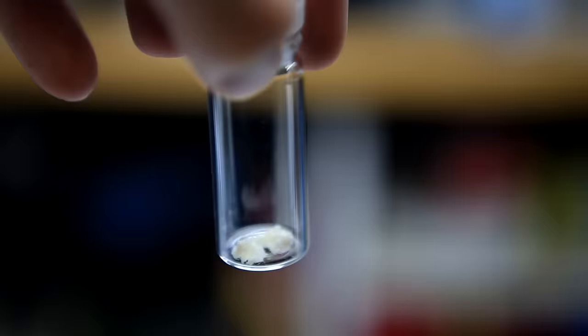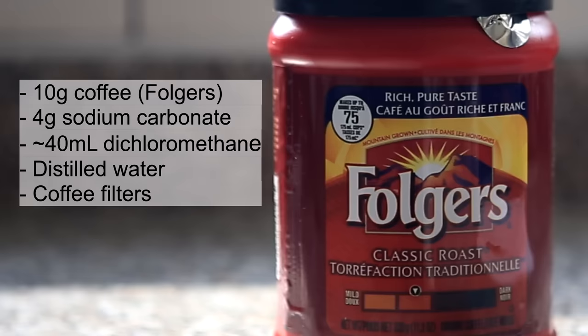I decided to go with Folgers coffee, but in theory you can use any brand. I decided to use the more classic route and not use instant coffee, but I actually think instant coffee works better and it's quicker because you don't have to do any filtration steps. Anyway, let's get started.